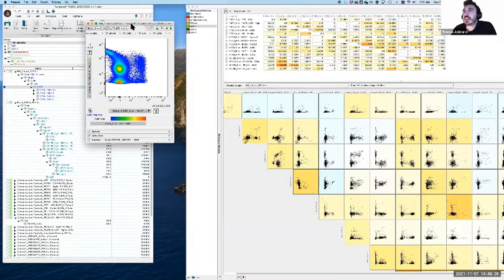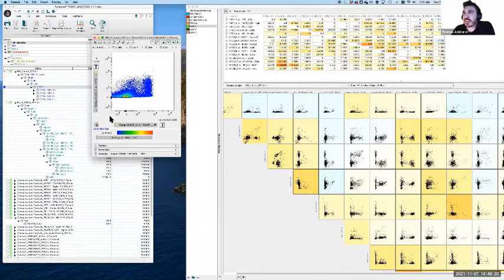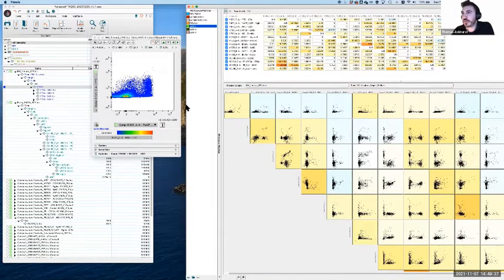All right. So PerCP-Cy5.5. Damn, I should have done this from a naive position. So that first one that we brought up was in this case FITC versus PerCP-Cy5.5, which is this one. So it's this stuff down here, the super negatives that we're trying to deal with in this case. So what we're looking for is some combination of fluorophore and detector that gives us that classic curve, which suggests to us that it's a mathematical phenomenon, not just something being expressed lower.